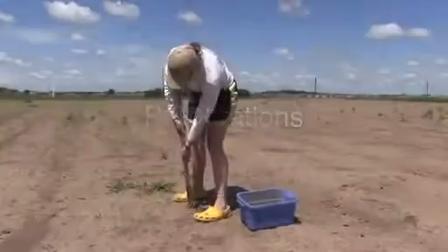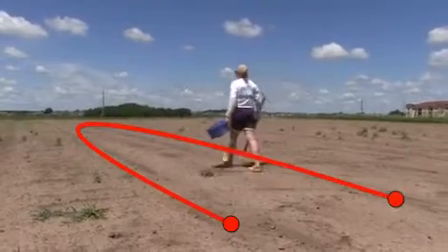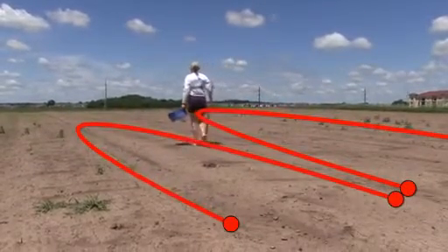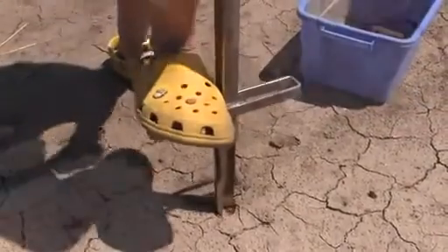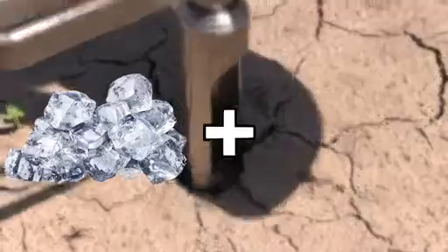In the field, you should account for soil heterogeneity, collecting soil samples in a way that will represent your site. To preserve the microbial community at the time of sampling, samples should be transported from the field on ice.